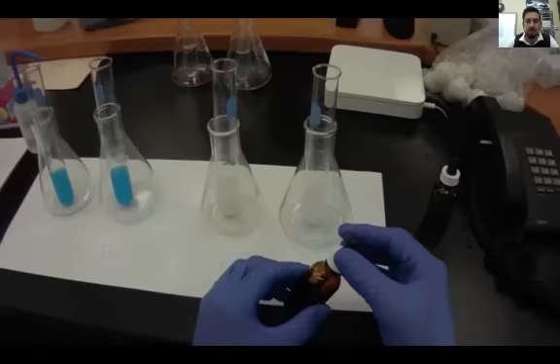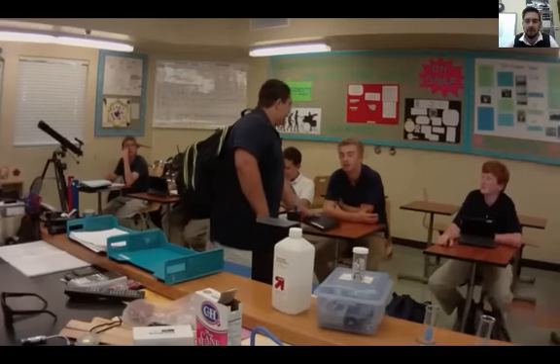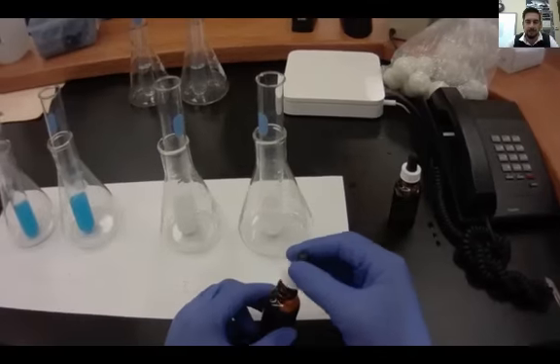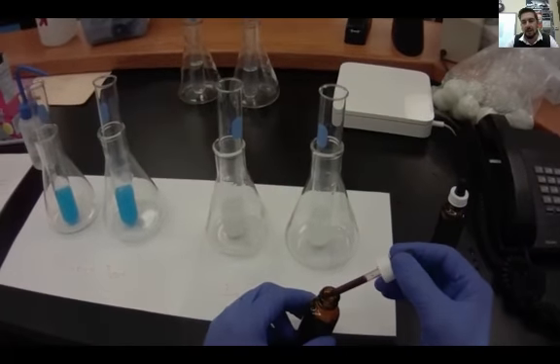Michael, what are you doing here? Get out of here! I don't care about your excuse, you need a note. Yeah that's right, you need a note bro, get out of here. Okay good. Back to my test, all right. I'm gonna go ahead and dump the iodine into both samples.